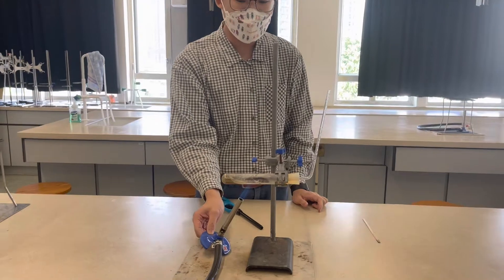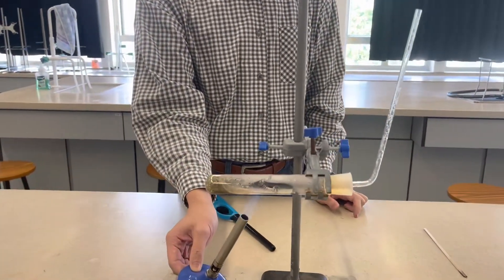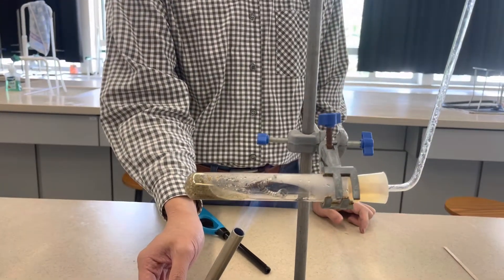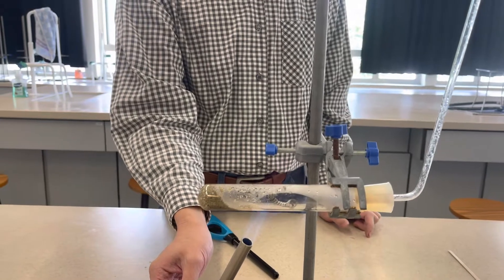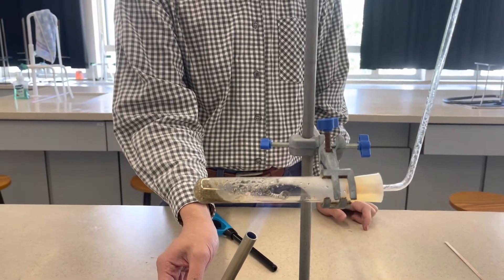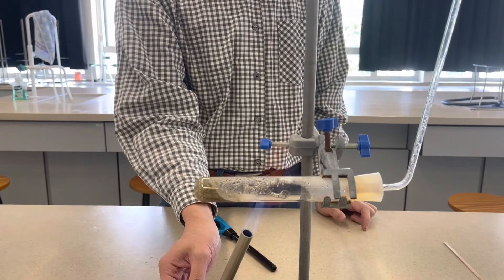Of course, because when I am setting up this experiment, there will be some water vapor there. That might make the magnesium a little bit wet.